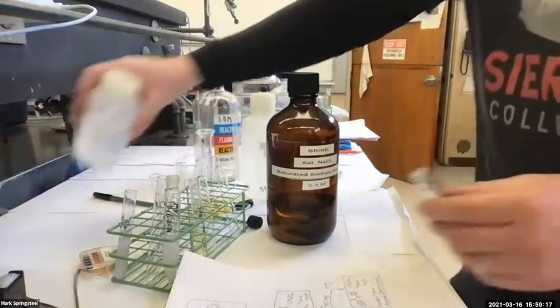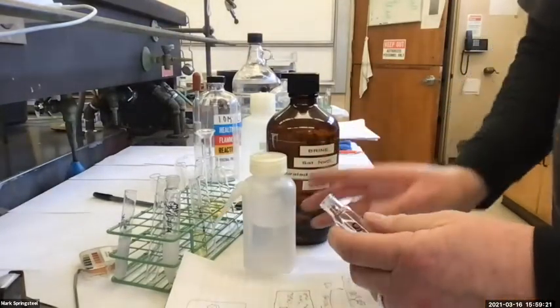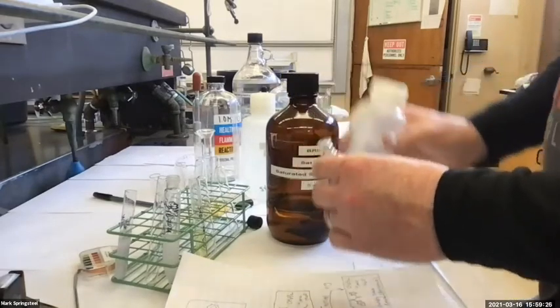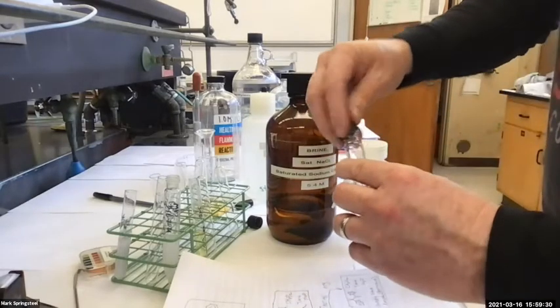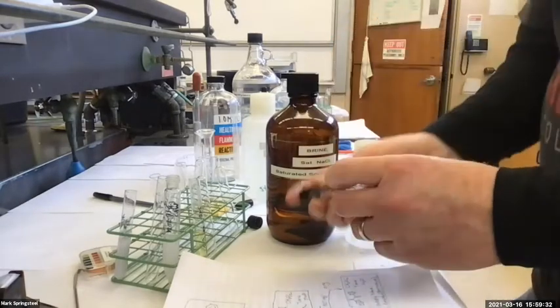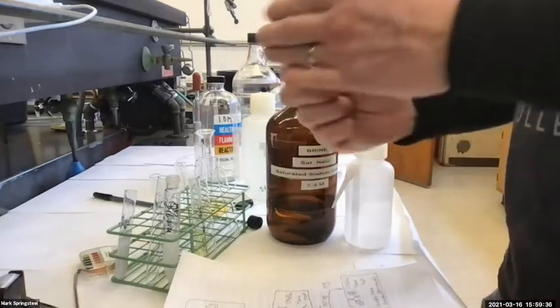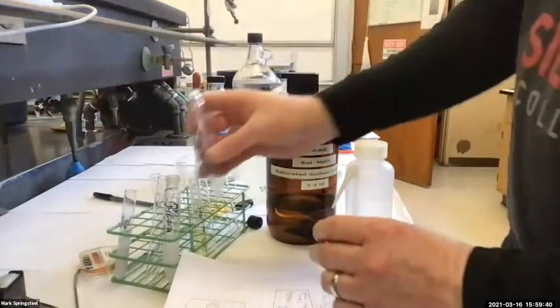So let me add a little water to test this test tube. This centrifuge tube, I felt the top, it feels good, like it's not cracked or anything. And this cap, the little Teflon disc in there looks good. Tighten it up. Yeah, this feels good. I don't think it's going to leak. Nice, put that down the sink, that DI water.